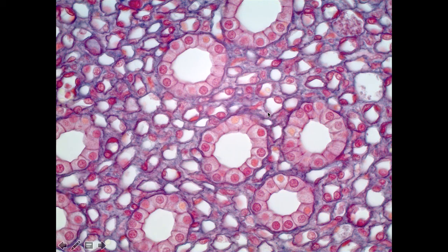Now, interestingly, we are not using this slide to study simple squamous like we just saw in the blood vessels. But the truth is a lot of these tubes, a lot of these ducts here are in fact lined with simple squamous, very thin with bulgy nuclei. So these are either tubes of the kidneys or small capillaries that are a critical component of the kidney. You won't be asked to identify the simple squamous layer in a kidney slide, but just so you know, that's what most of these tubes in this view are. We're using this slide for lab just to highlight these simple cuboidal cell layers.